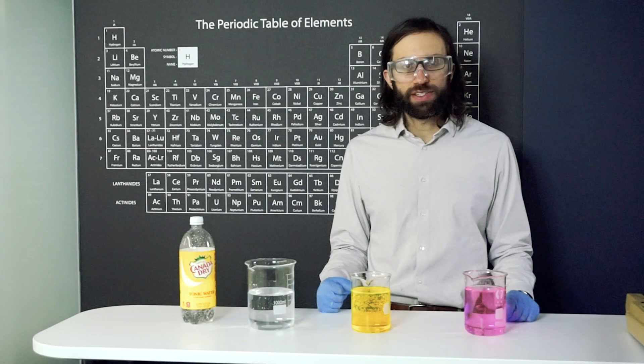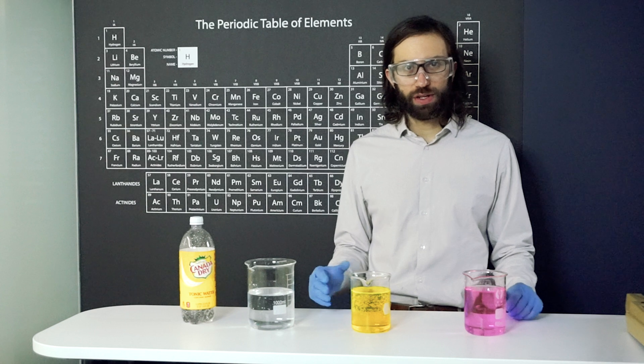Okay, so this is an experiment about fluorescence. We have three different solutions.